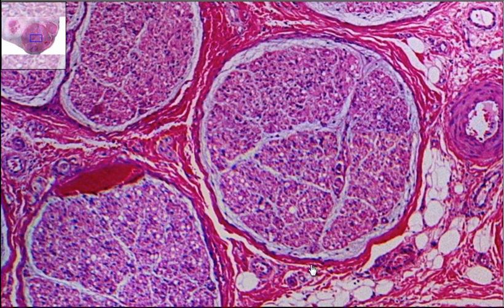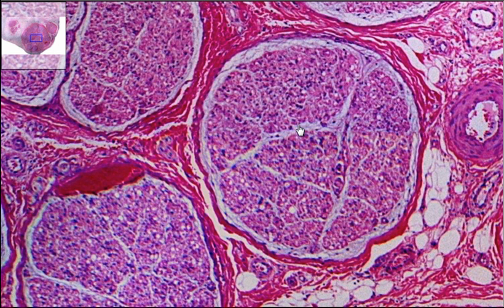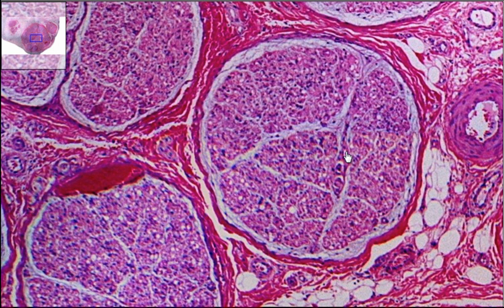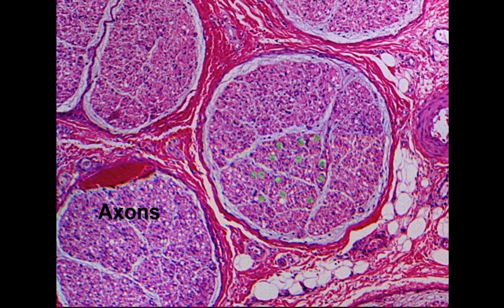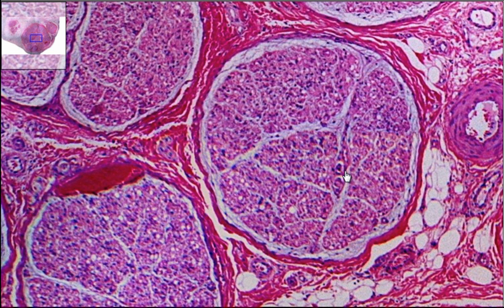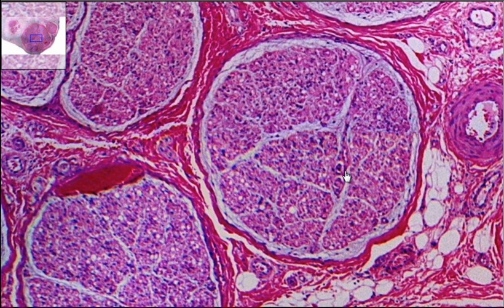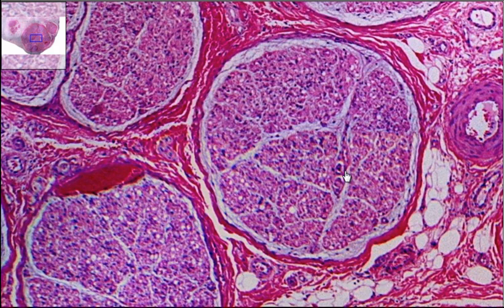So what is inside a fascicle? It's not the clearest in this image — we'll get another slide that has a better image of a fascicle. But each one of these little dots is going to be an axon. So you have one axon here, one here, one here, one here, one here. We have hundreds, if not thousands, of axons all grouped together to make up the fascicle. Those axons also have a layering around them — they're covered with another connective tissue referred to as the endoneurium, and that's what wraps around each individual axon.